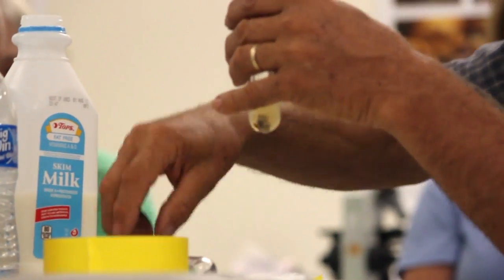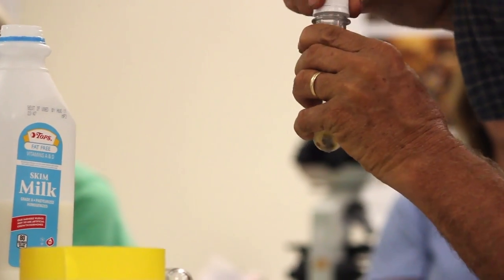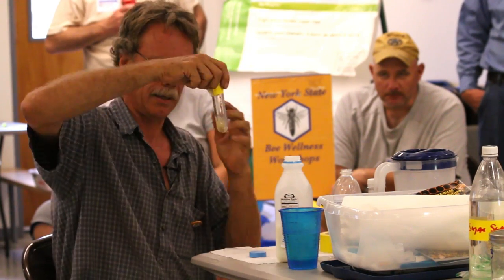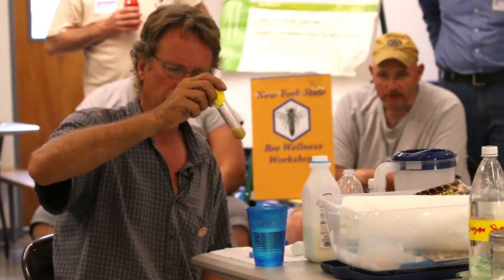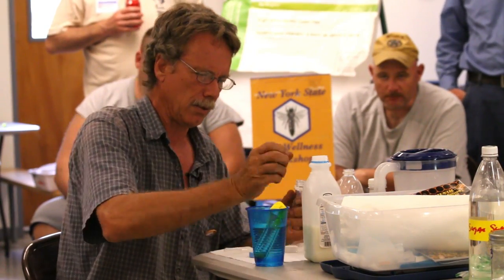So there's some nice cloudy water here in our marked one. Swirl it around and make sure that the enzyme gets broken loose from the larvae into the solution. You can accelerate this by putting it into a cup of hot water. We're going to do the same thing to this one now.